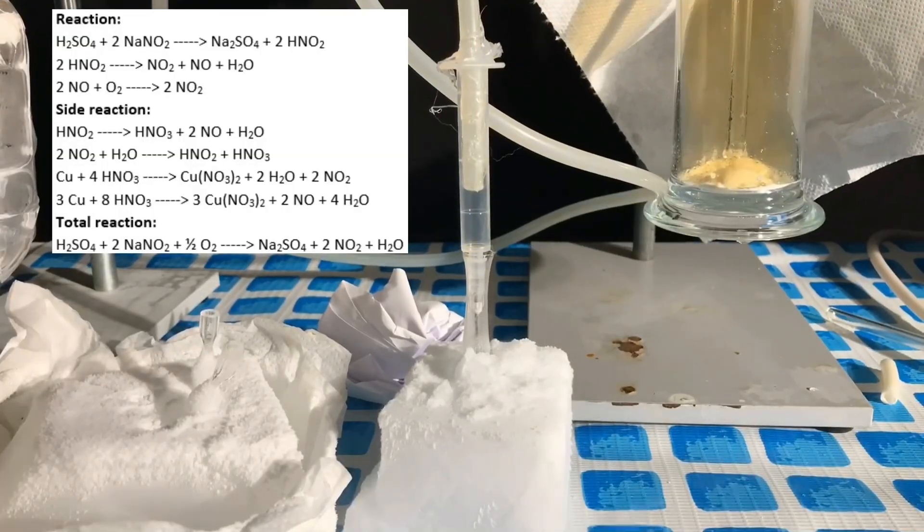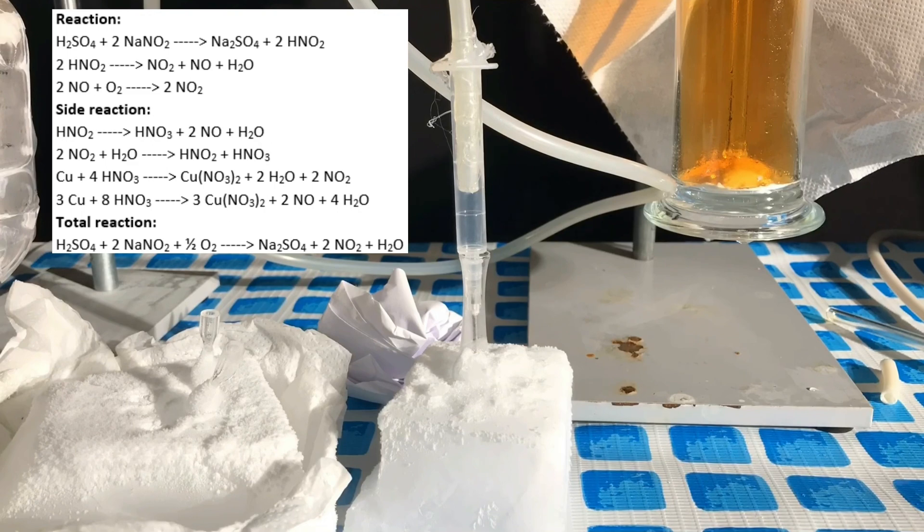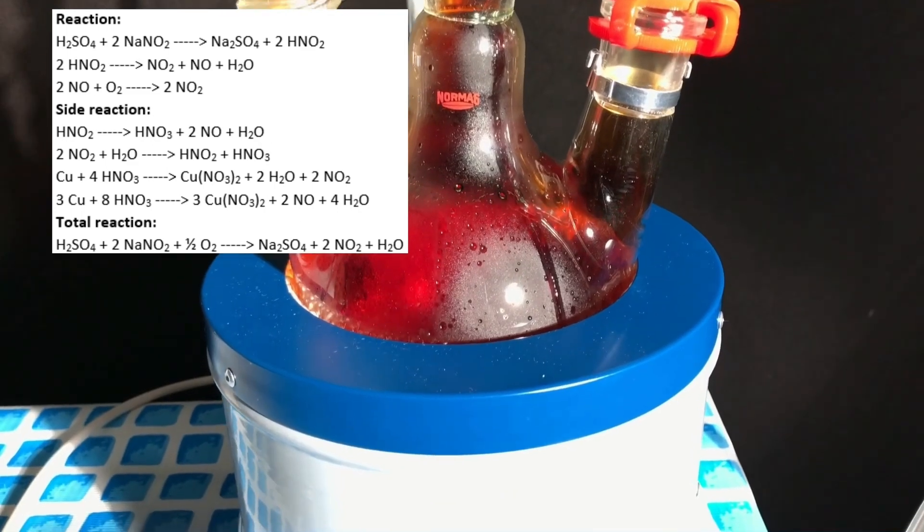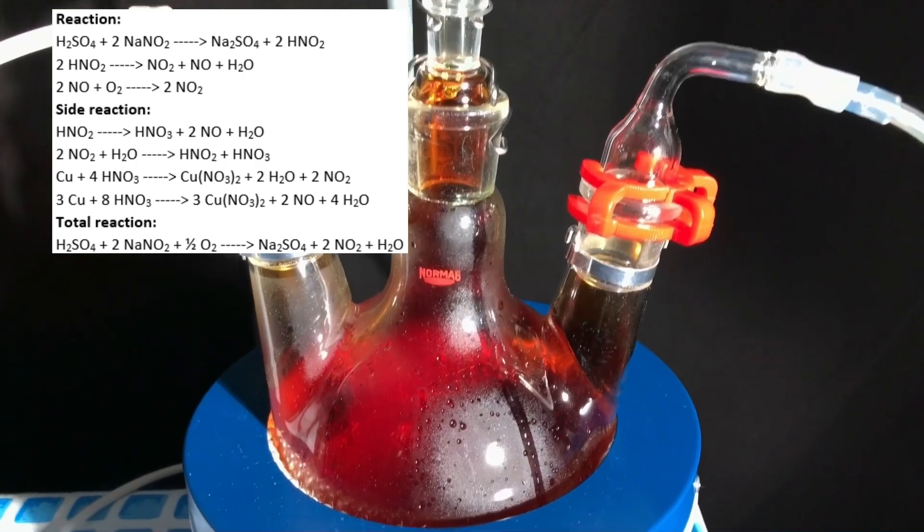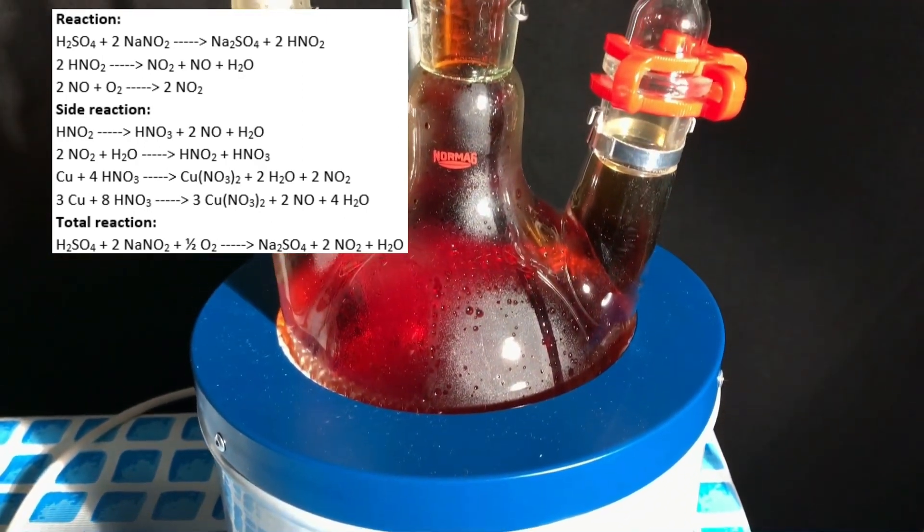Those are the reactions and side reactions taking place. I actually planned to use copper to get rid of some nitric acid that is also formed, but in the end I decided against it because the amount of nitric acid formed should be considerably small.